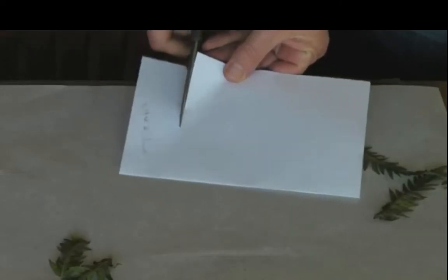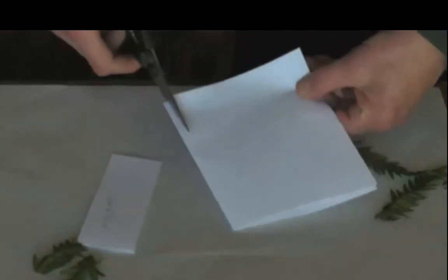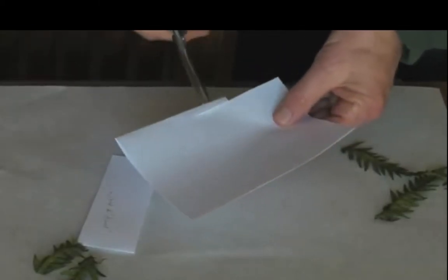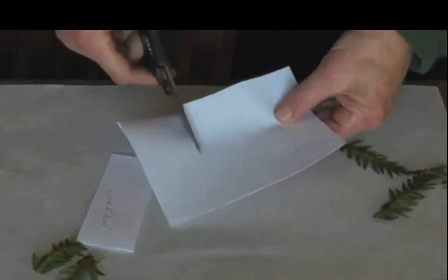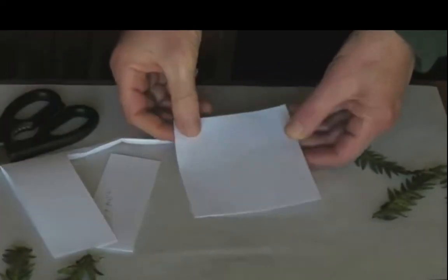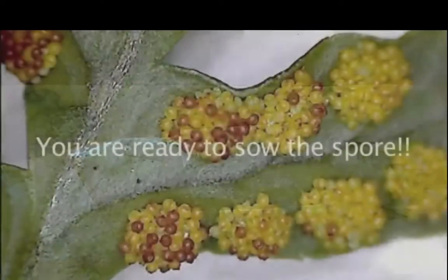The final preparation step is to decide how much you want to sow, and I can't stress enough that you need way less spore than you think you do. So take some scissors and cut out a section of the spore. In fact, it's a good idea to cut several pieces with different amounts of spore on each one, and sow multiple Petri dishes so that at least one will have the right density of spore.